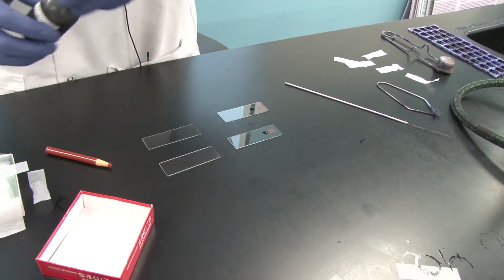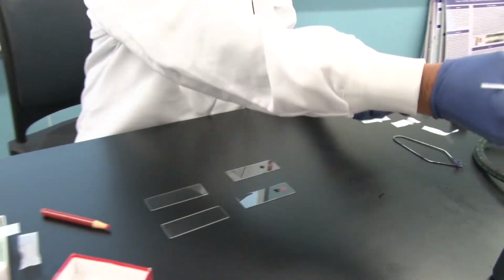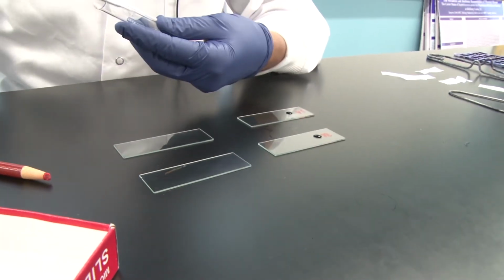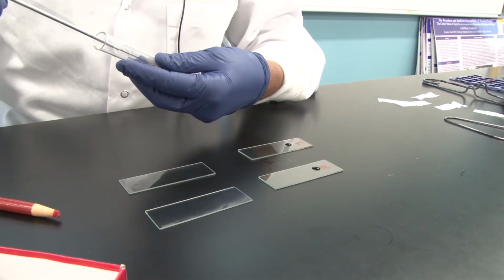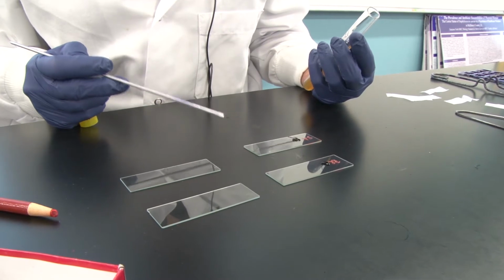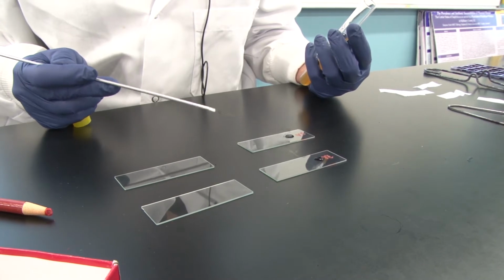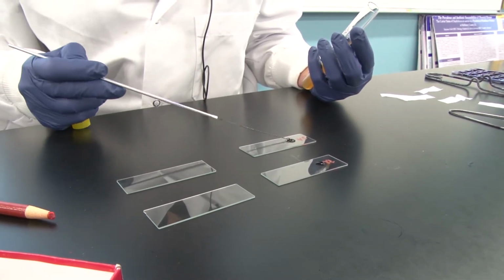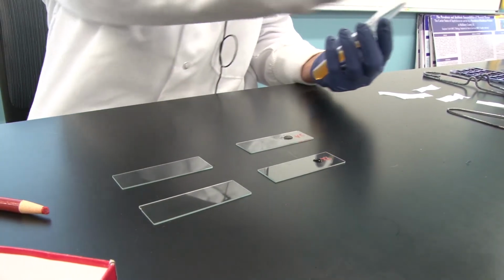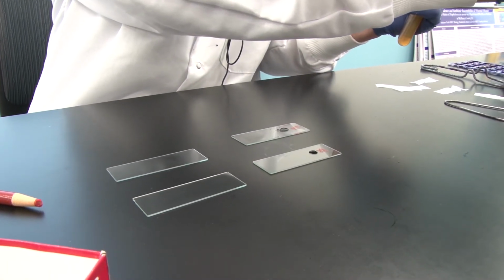Into that drop of nigrosin, I'm going to add my stock cultures. So I'll grab Staph aureus first. Flame my loop, of course. Cool it down. And I'm going to grab a little bit of Staph on the end and tap it into this nigrosin. I am not spreading the nigrosin. I want to keep it as a drop. And you'll see why in just a moment, but I'm going to tap off all those cells that I just picked up. I'm going to flame my loop again and get the Rhodospirillum rubrum.